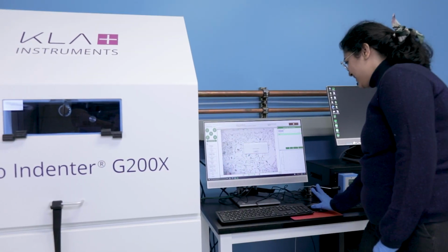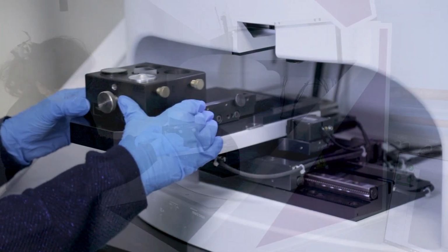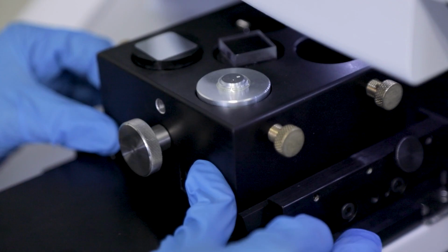Nanoindentation has really grown out of the research and development labs and also out of universities. And more recently, it has seen a lot of adoption in industry settings themselves. This is primarily because of the workflows that we have integrated into the systems, the ease of use that we've put into the systems, and because it has so many applications in different industry settings to really improve productization and optimization of processing. So the most recent fields that have grown into this are really around your high-tech industries.